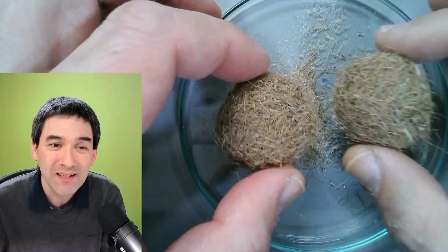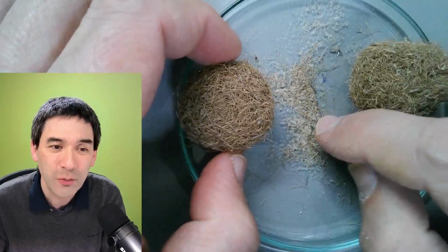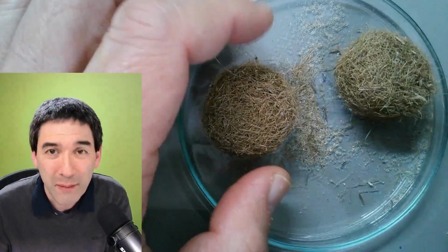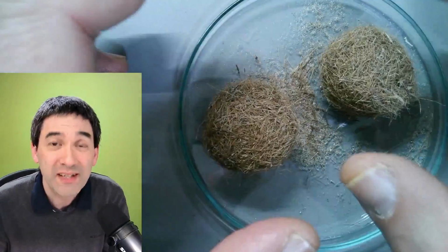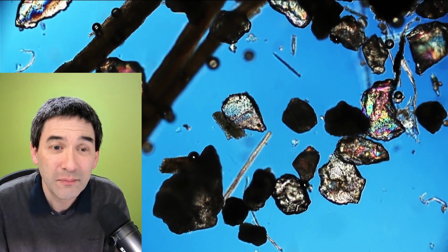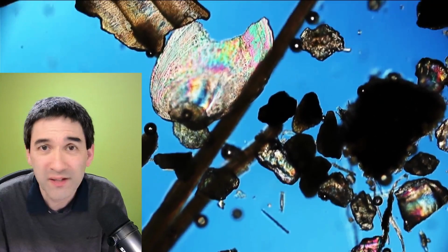But the interesting thing is the following. Look what happens when you bounce them here. Then you can see that there's quite a bit of sand caught between the seaweed, and it's the sand that I put under the microscope, right? And I just want to show you a little bit of how the sand looks and what I found there. Yeah, this here is the sand. You can see it's sand grains, of course, quartz, the seaweed itself.